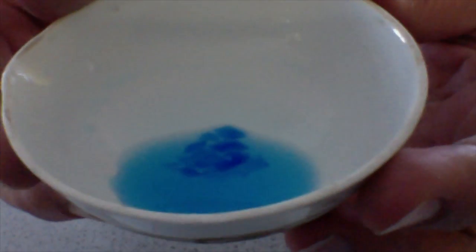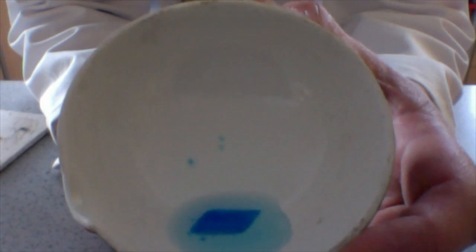This one has been left to form quite slowly so you can see the crystals inside. Here we formed a beautiful, large copper sulphate crystal.